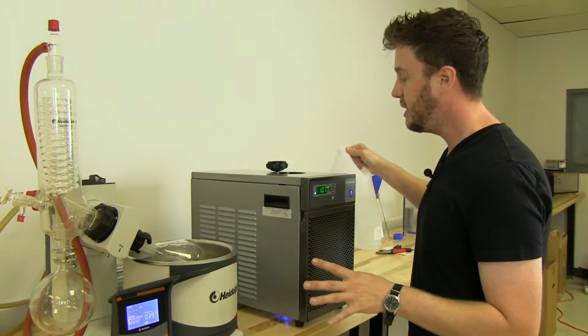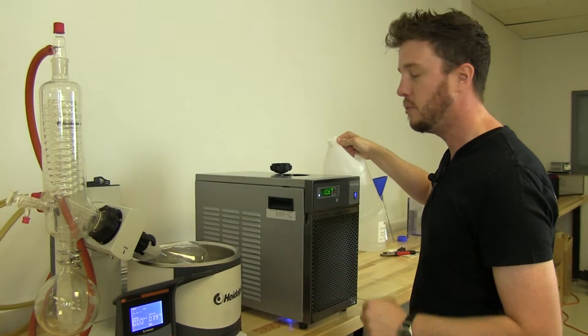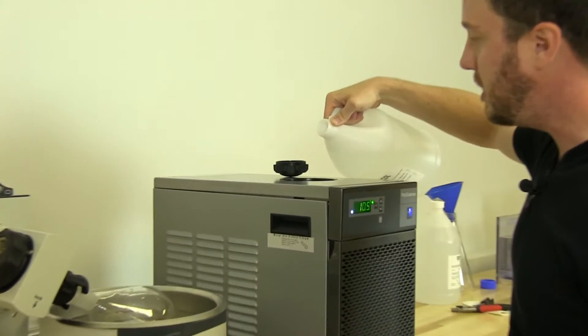It can be distilled water, that's preferred. If your water has a lot of calcium or minerals, we don't want that in the mix.